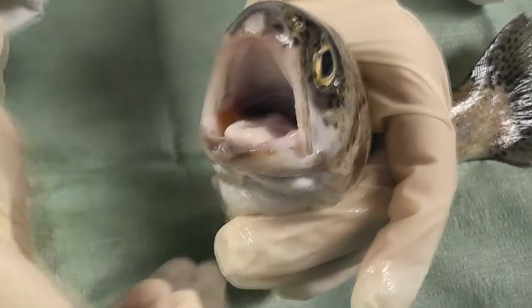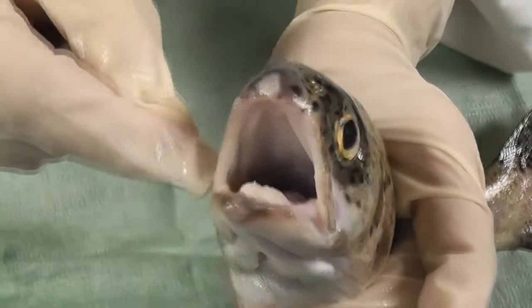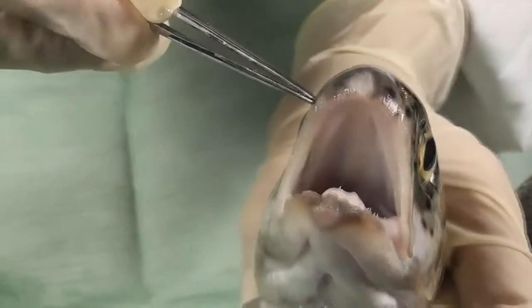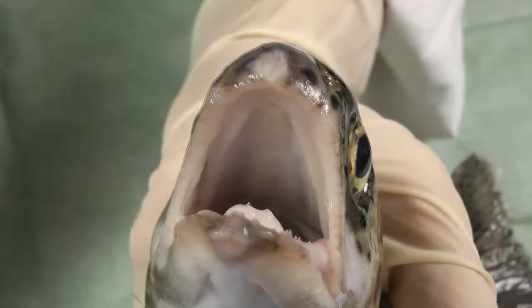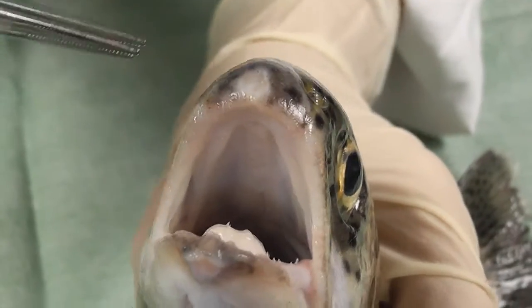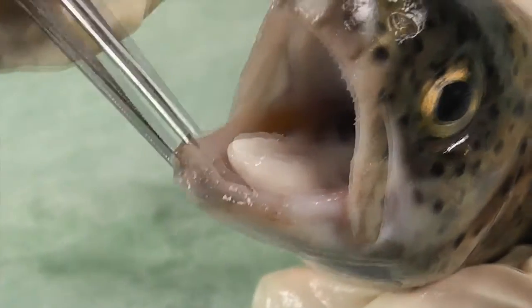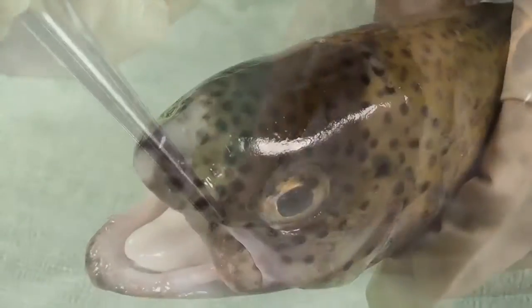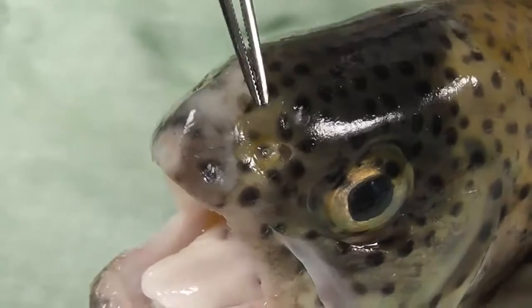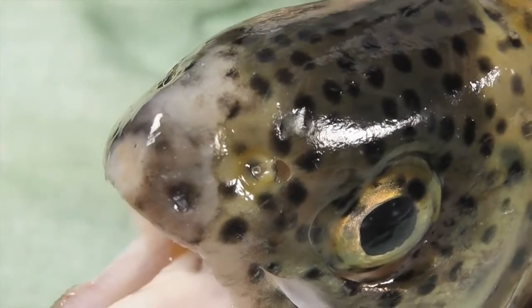We can observe also the upper jaw and the teeth of this fish, which are sharp and needle-like, which they use to grab their prey. In the nostrils, we can observe the presence of the olfactory rosettes.